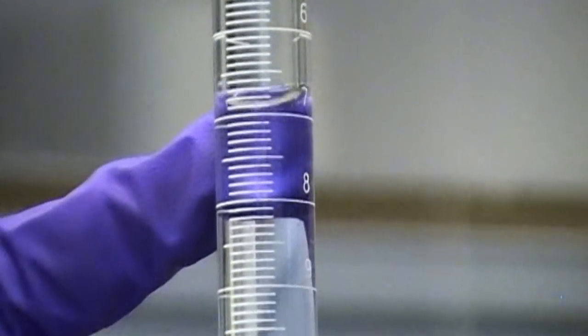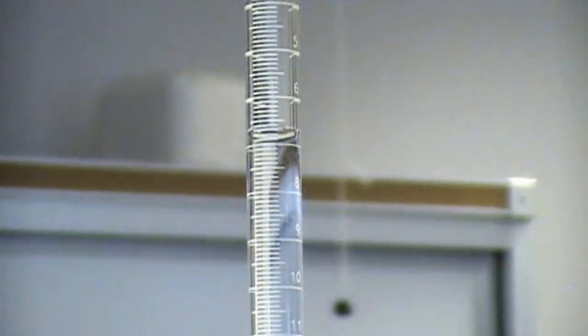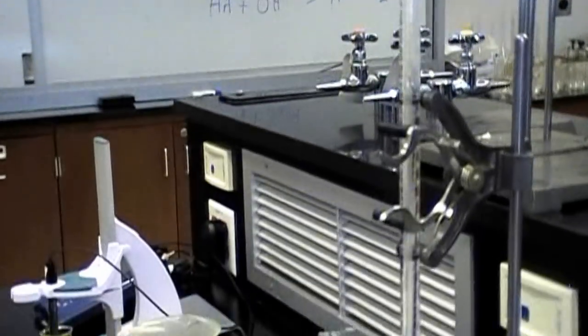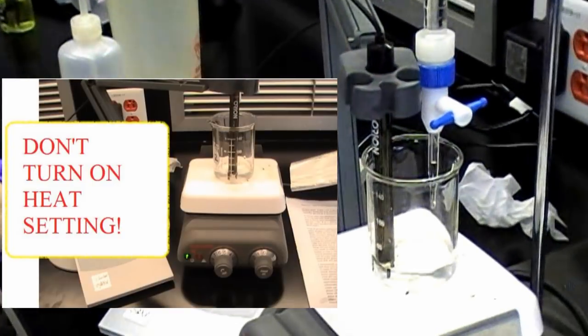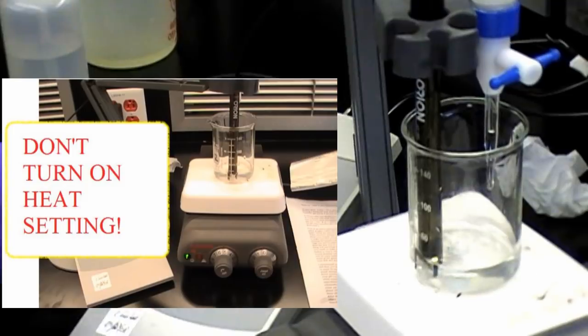Record to the nearest hundredths place accurately on your burette. Also, do not turn on the heat setting because you do not want to boil your solution.